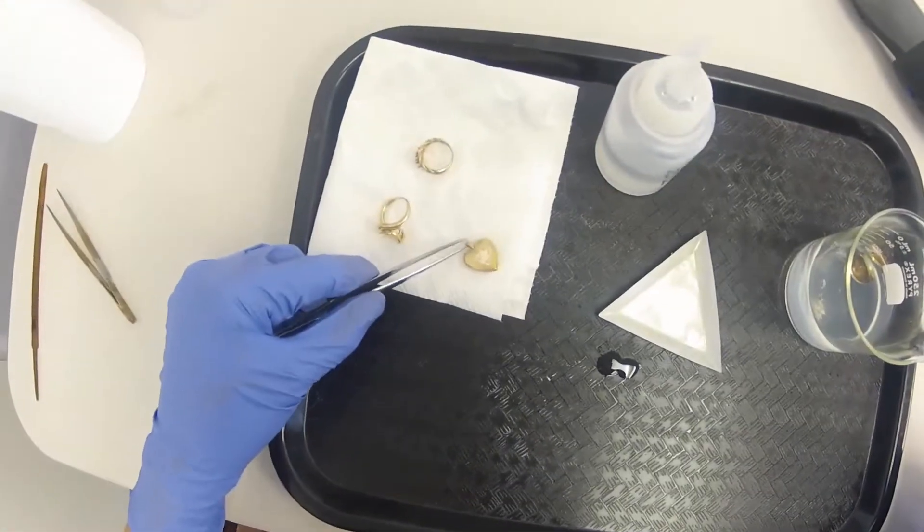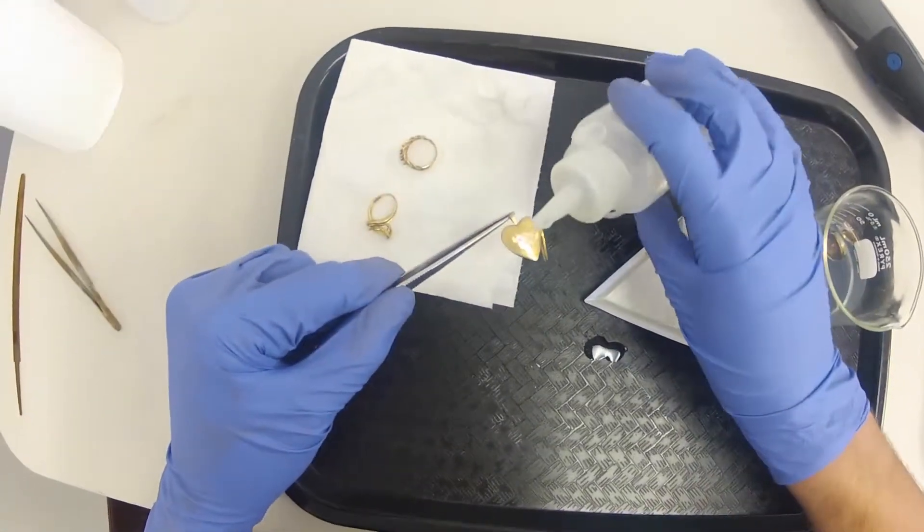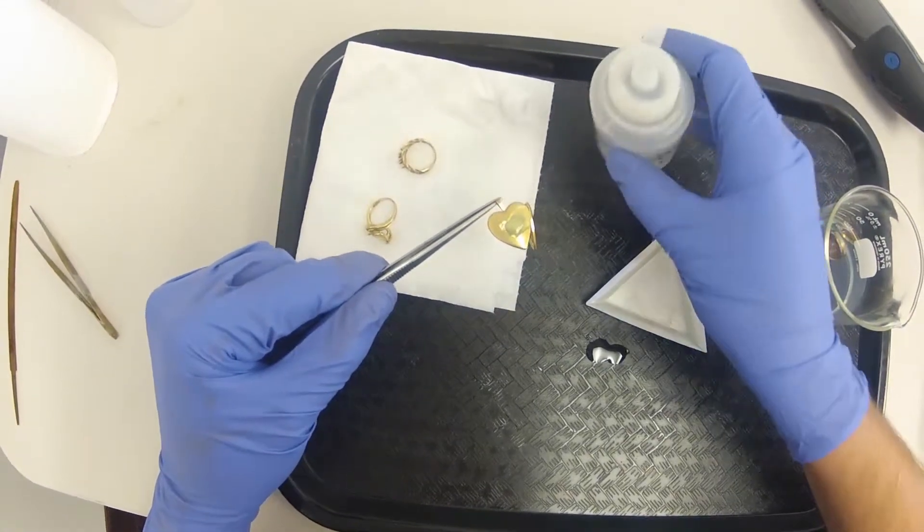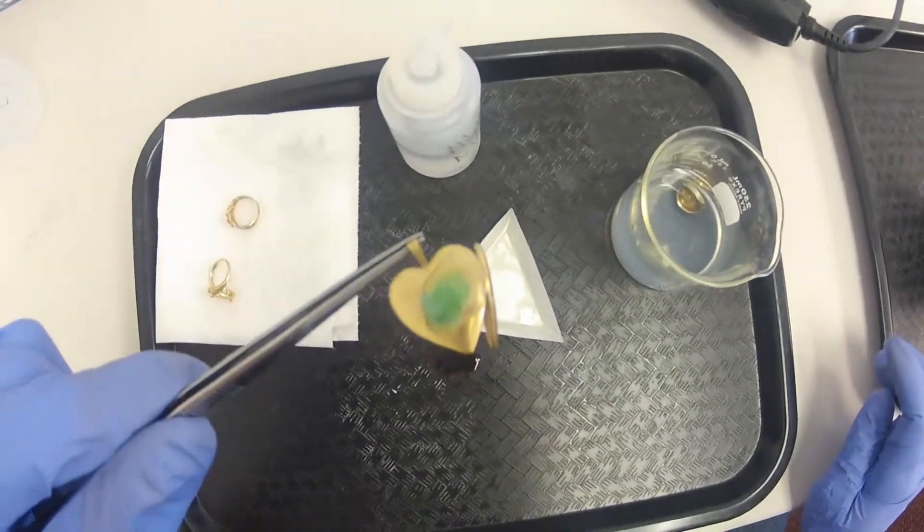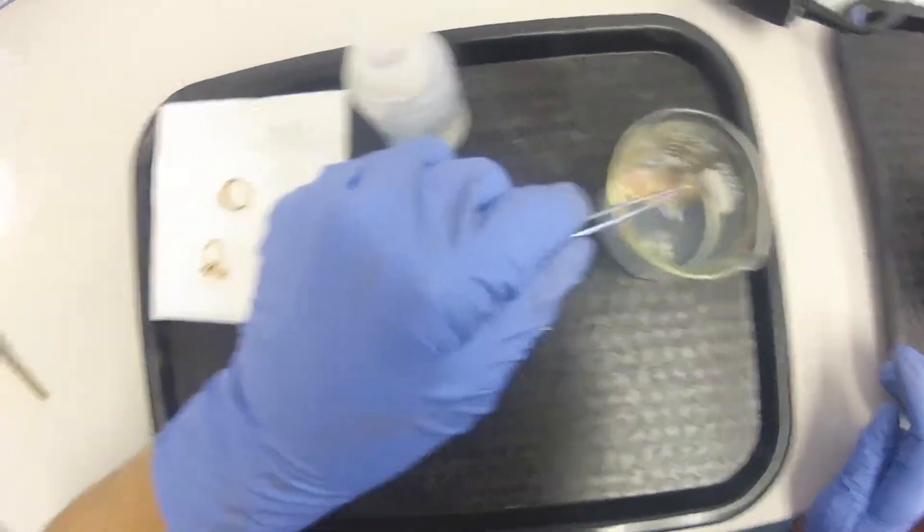So we'll take our little locket here, we'll also put a drop of acid on there. Same story with this one as well, so we'll put that in the water as well.